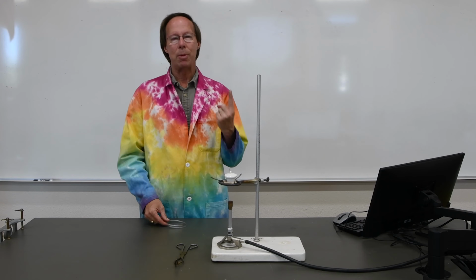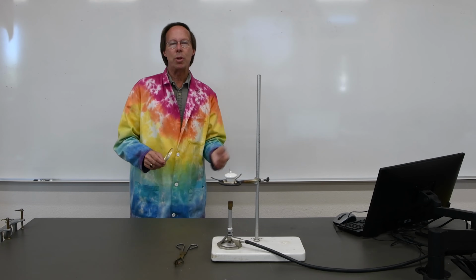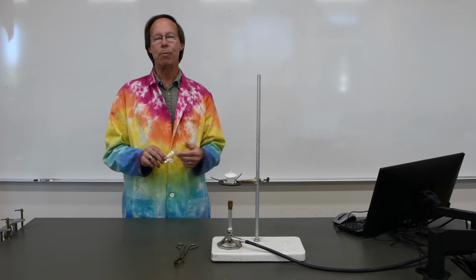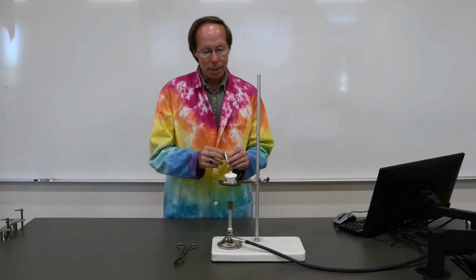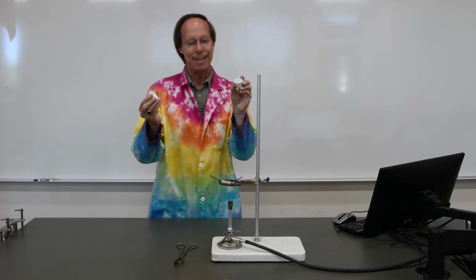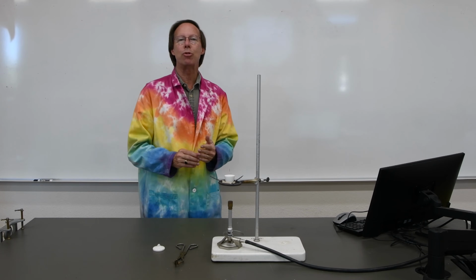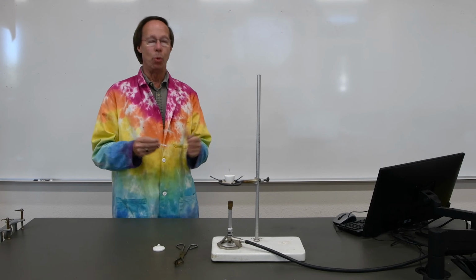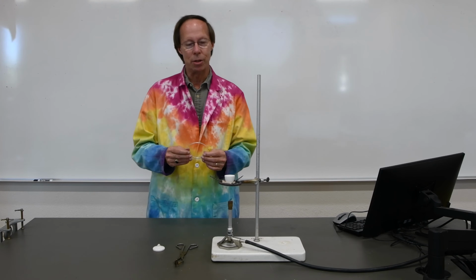So we have our grams of magnesium, grams of oxygen, and just like we learned in class, we can convert those into moles, get a mole ratio, and that will provide us with the empirical formula. Now we're going to be burning our magnesium in one of these ceramic crucibles. These crucibles are designed to take a lot of heat, and we're going to be heating it over a very hot Bunsen burner flame because magnesium ribbon is a bit difficult to ignite. Once it starts burning, it really burns, but it takes quite a bit of energy to get it started.